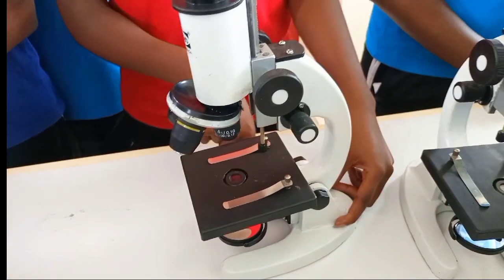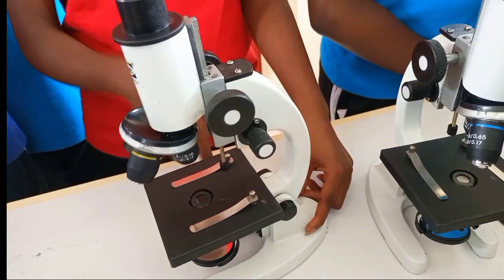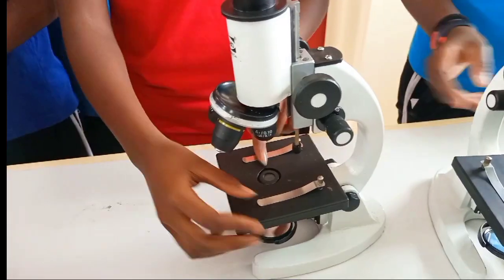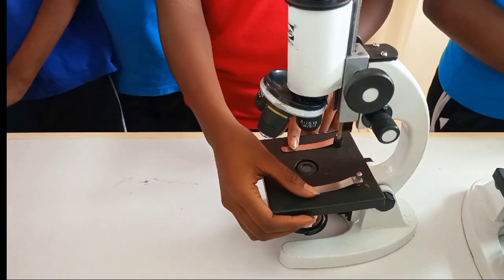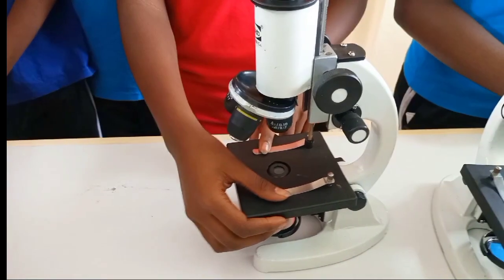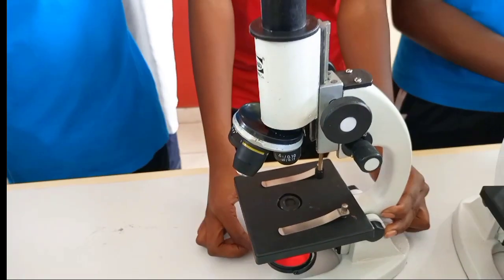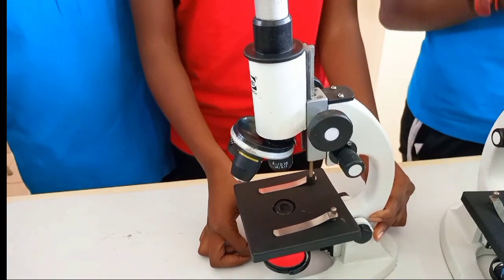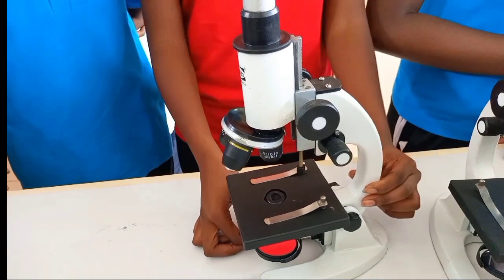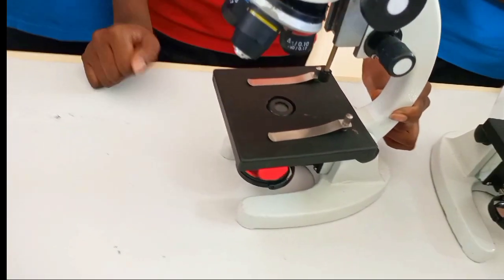The base supports the microscope. Clips are here — they hold the slide containing the specimen. The mirror is here and it reflects light coming from the source to the stage.